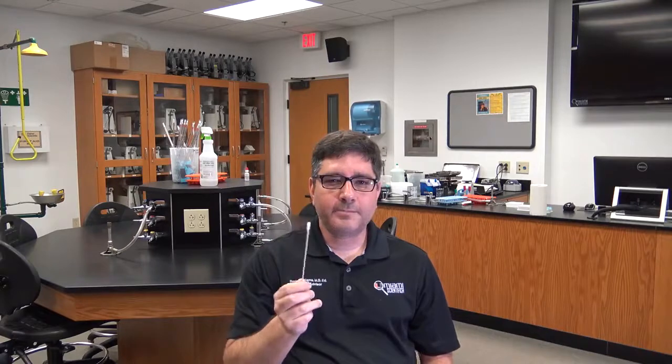To conduct your throat swab, you will need to employ the services of your lab partner. You will say, "ah," and they will swab the back area of your throat, specifically the tonsillar area, which is back where your uvula is, but on the sides of your throat. Care should be taken not to touch the tongue or the roof of the mouth. Both swabs should be treated as biohazard waste and disposed of in the biohazard trash. You will not reuse your swabs.